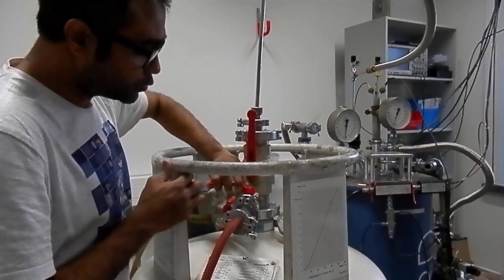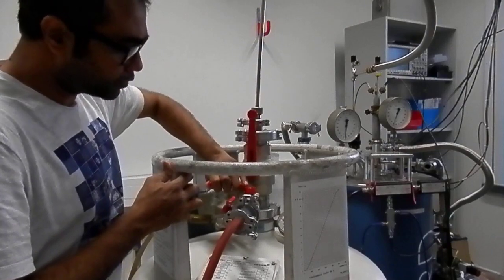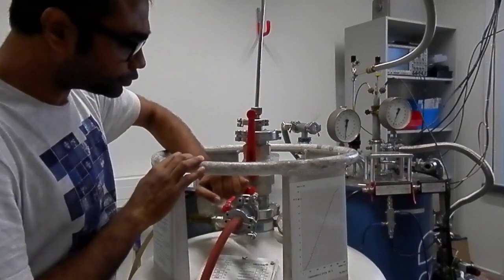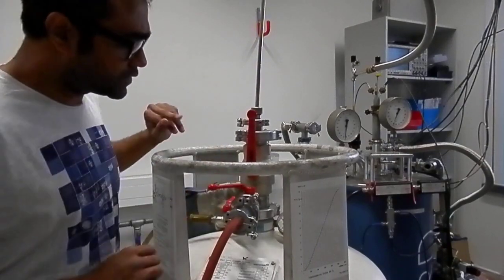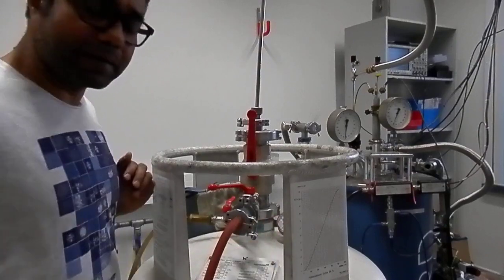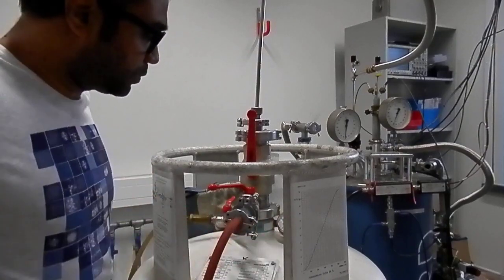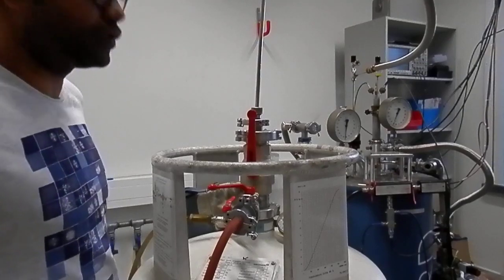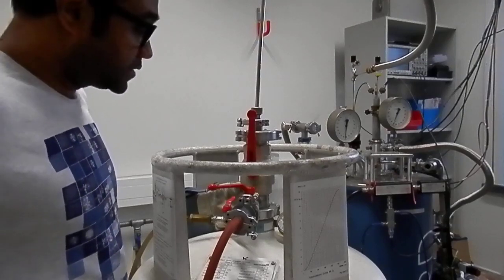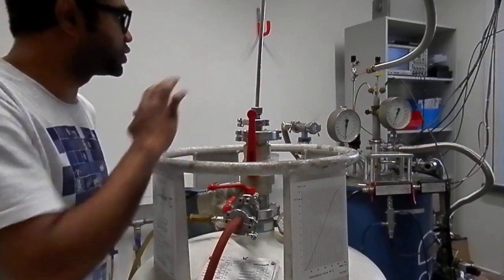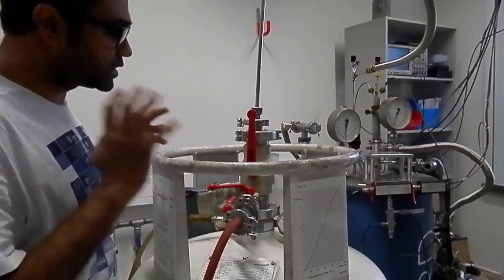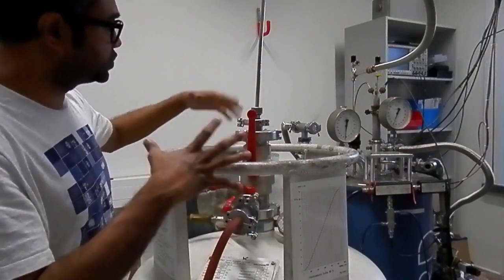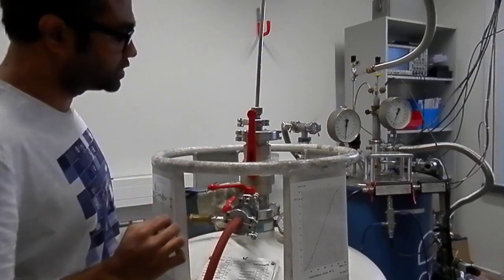So what you have to do is put a little bit of helium gas from the outside so that you can maintain a pressure of 0.05 or 0.1 bar. And this 0.1 bar would be sufficient to transfer helium from this vessel to this magnet.